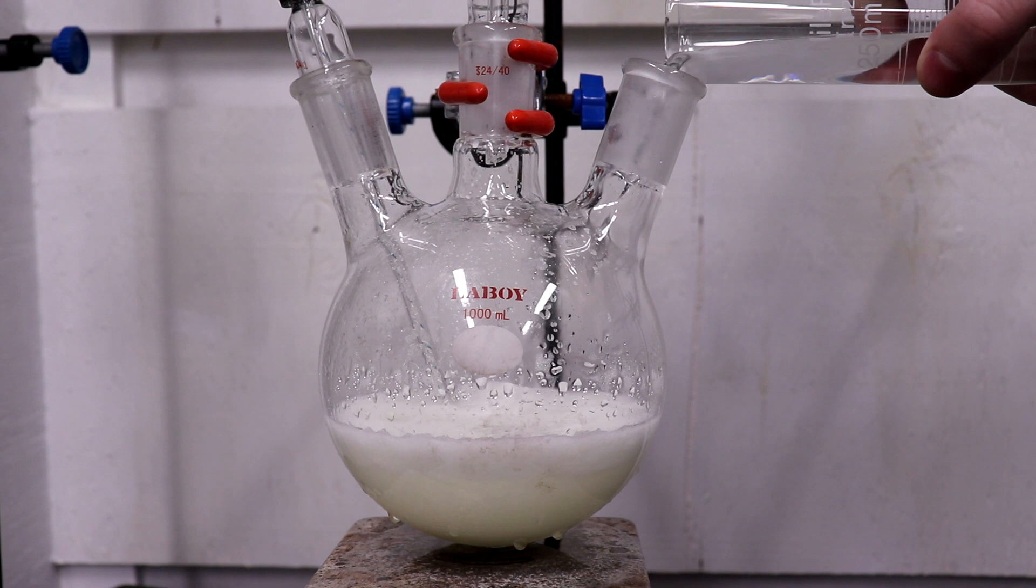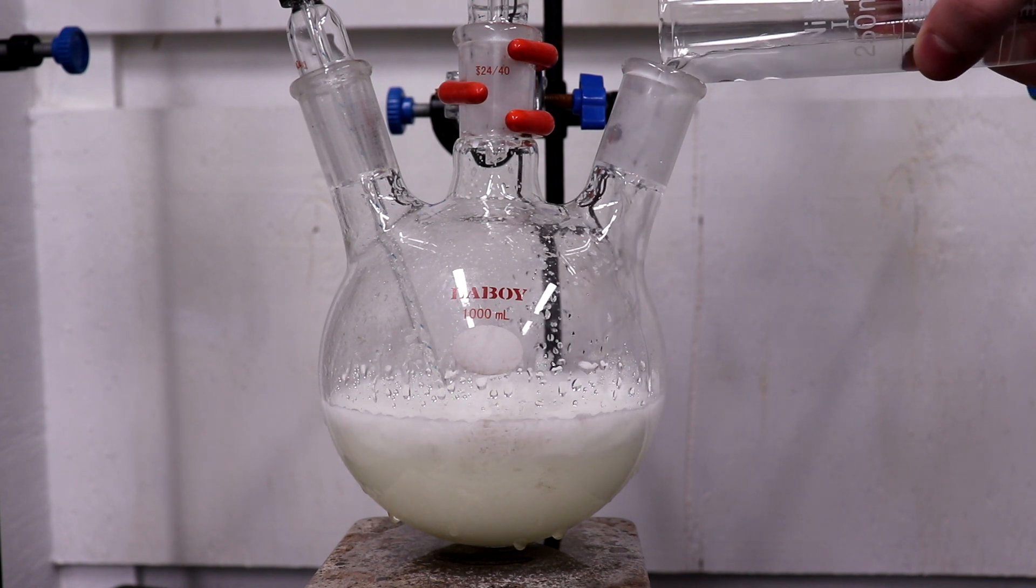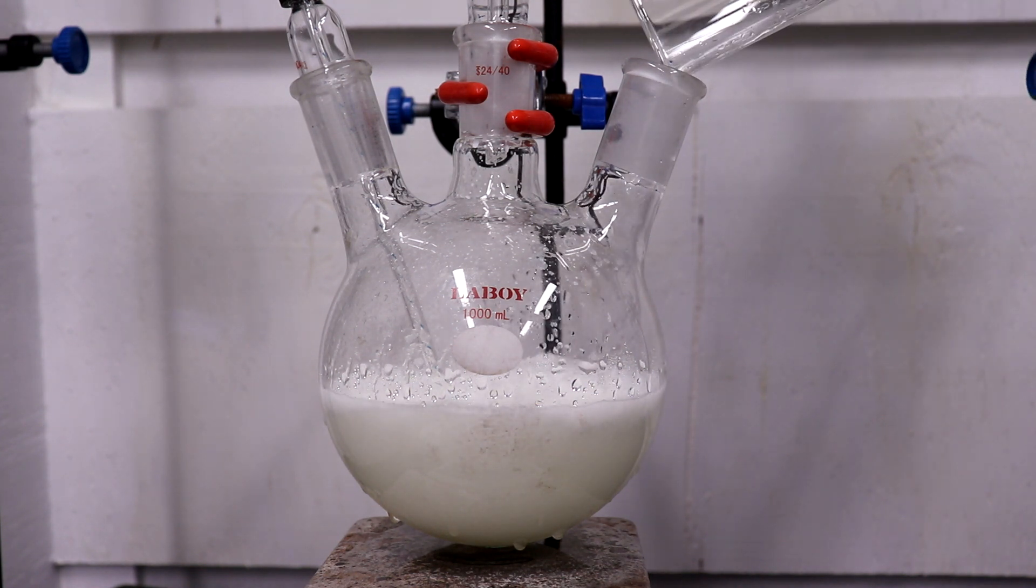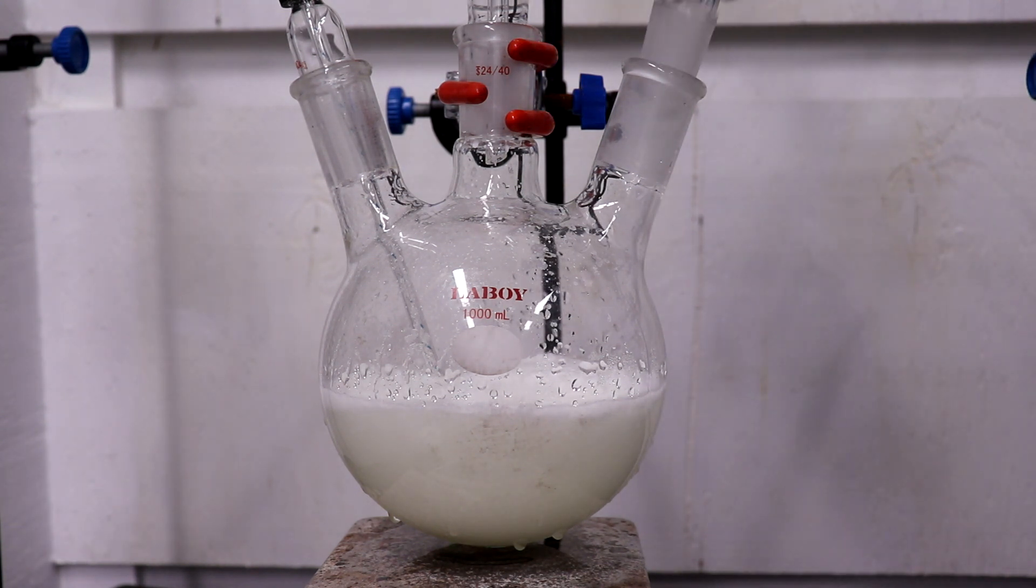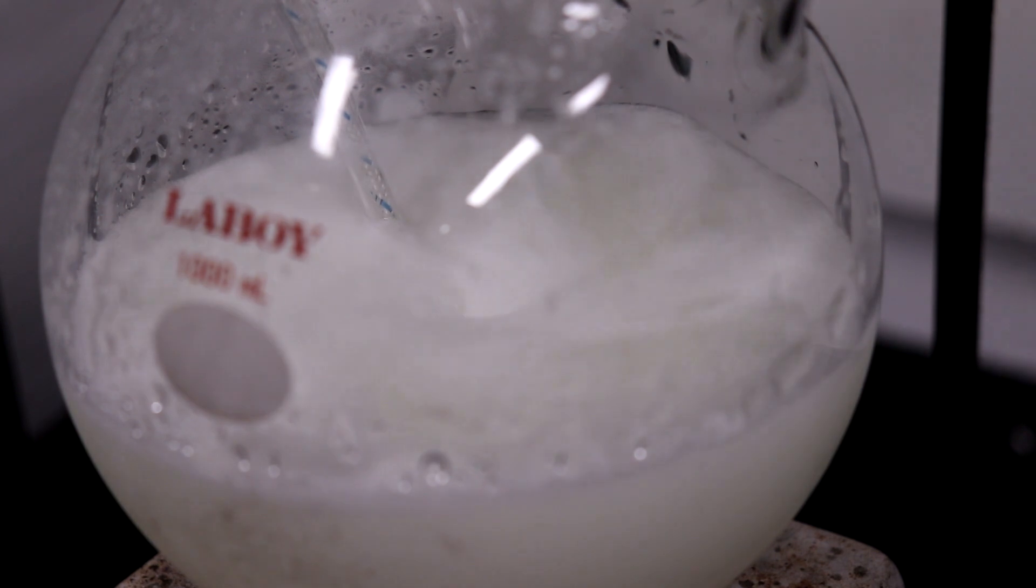200 milliliters of water was added to the mixture and stirred for about 5 minutes. It was then transferred into a separatory funnel, and the flask was washed out.